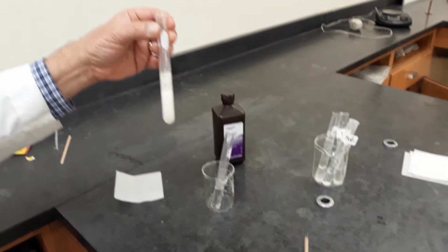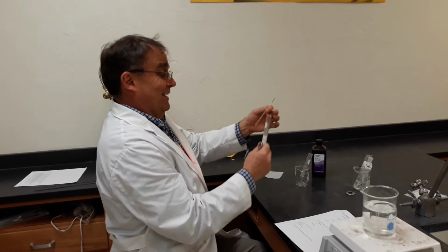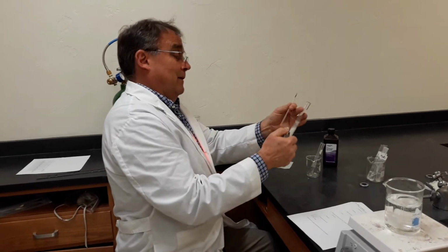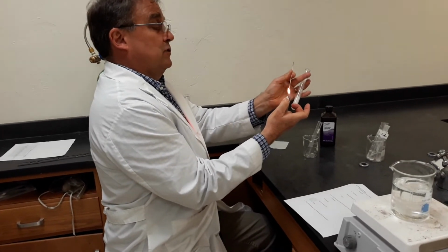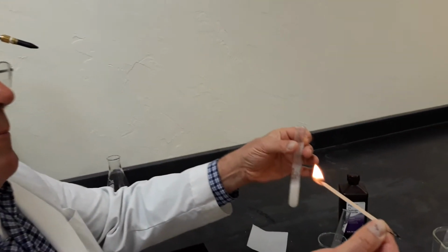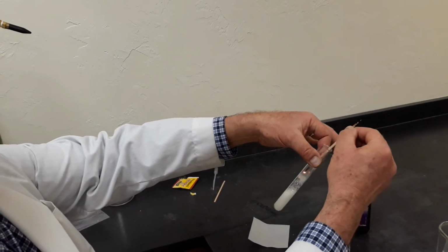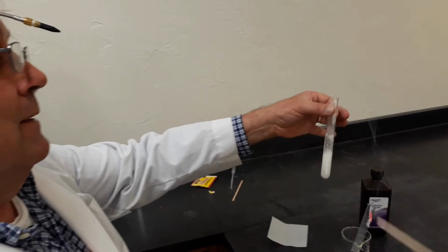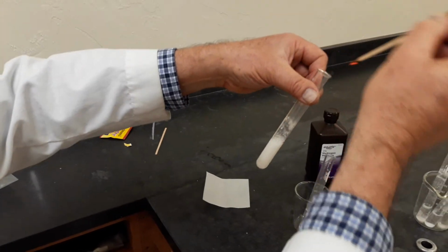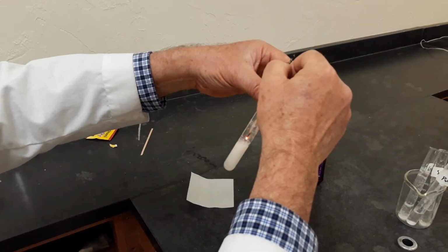Oh, rats. Science is messy. What should have happened? Shoulda, woulda, coulda. The oxygen should have flared up the stick. We'll see if we get that action going. There we go. Try it again. There we go. All right, oxygen. Cool.